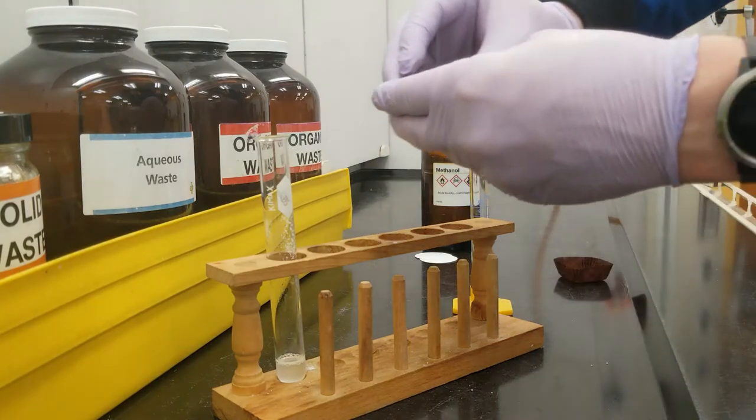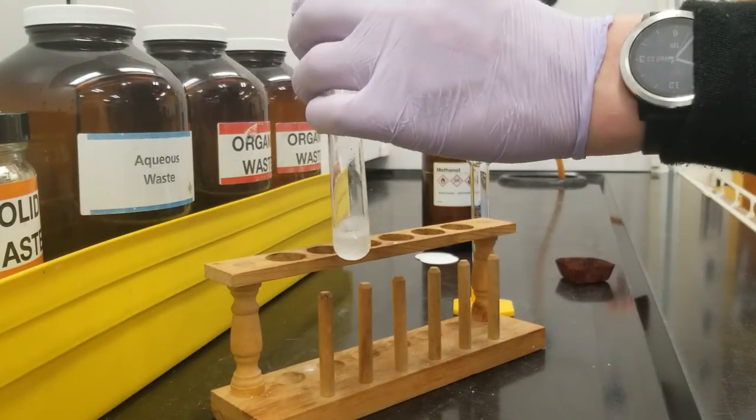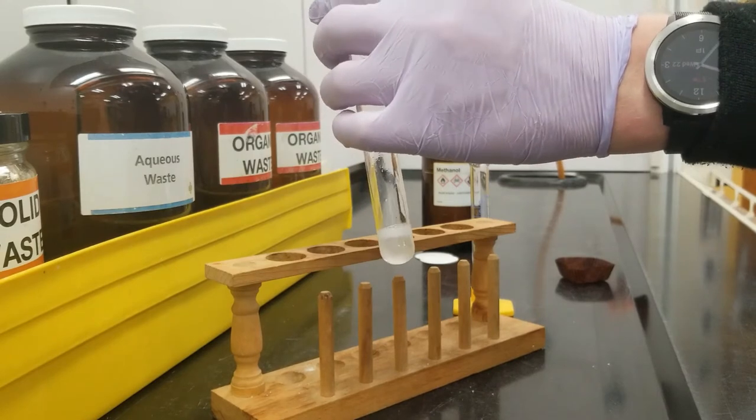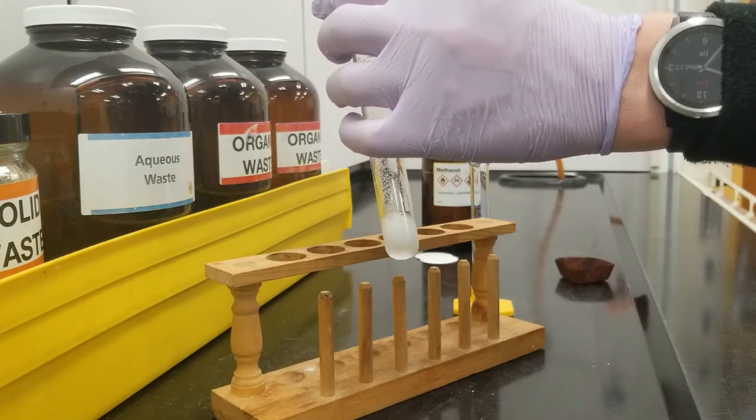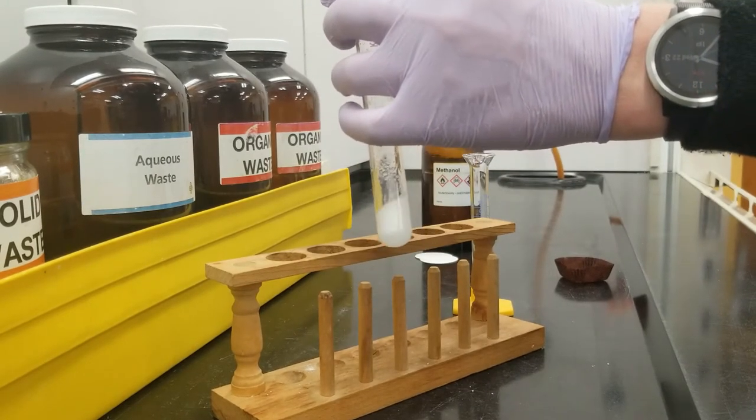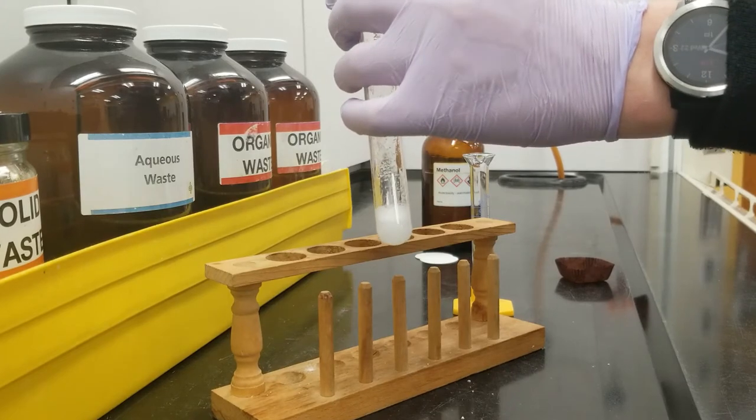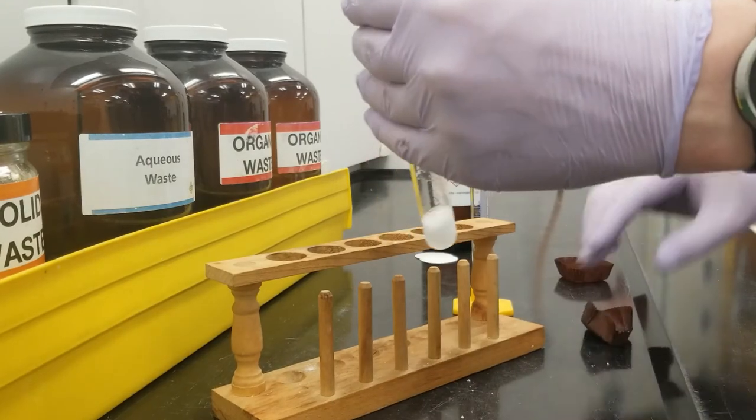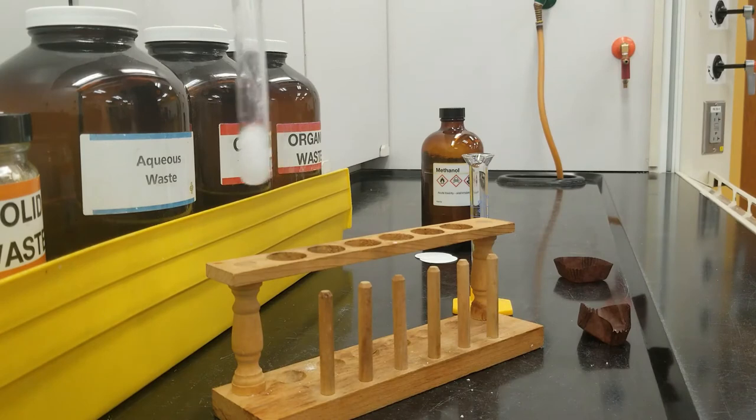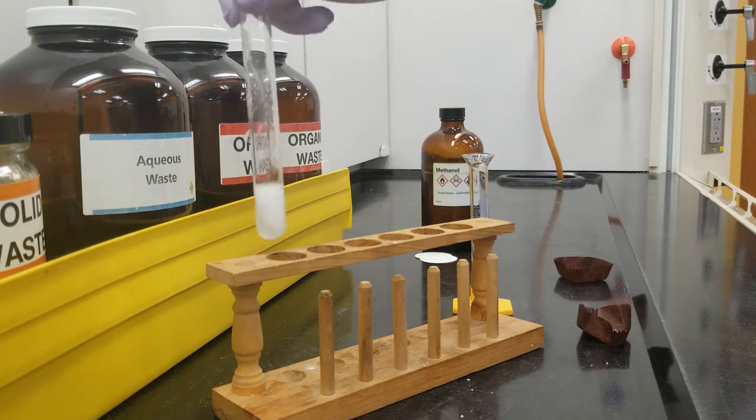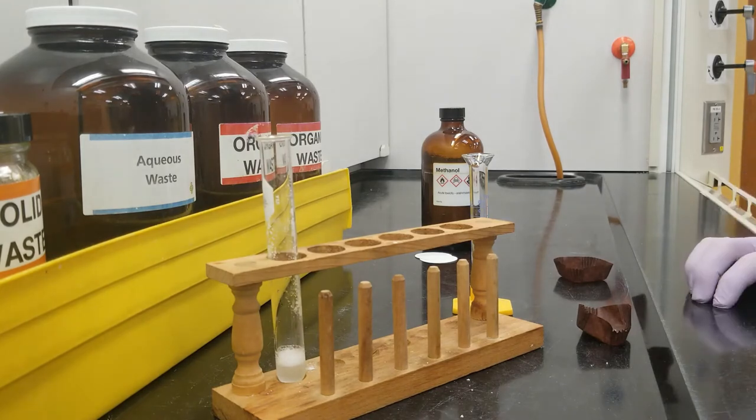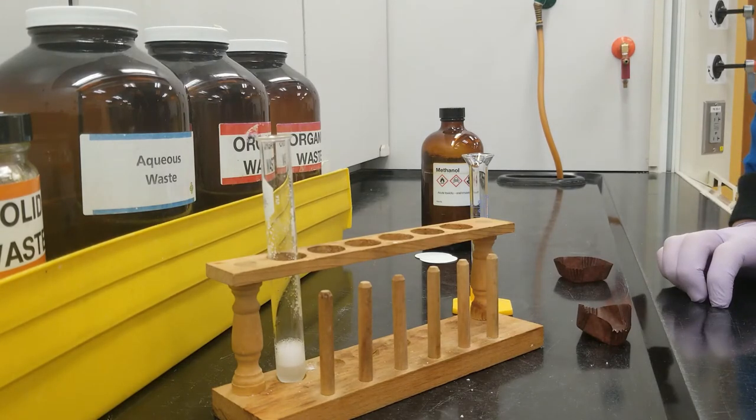That hydrogen gas, if you produce too much of it at a time, can actually be dangerous because it's highly flammable. At the scale that we're working at in this lab, and in the complete absence of a heat source, I'm not worried about the flammability too much, but always something to be aware of when using sodium borohydride.